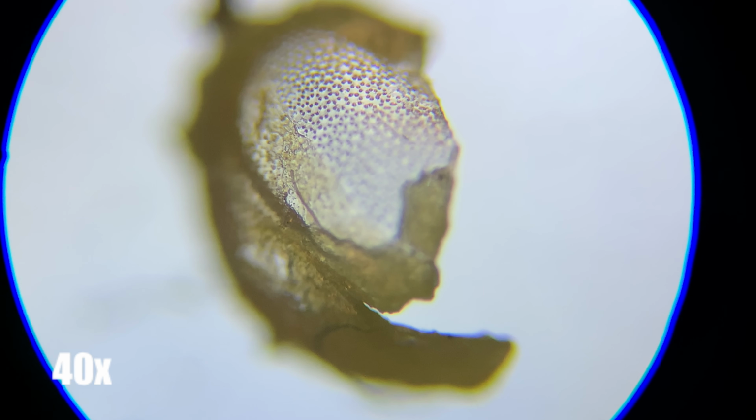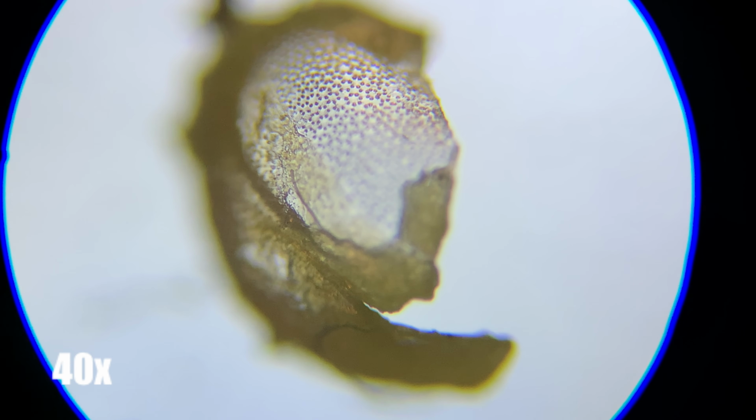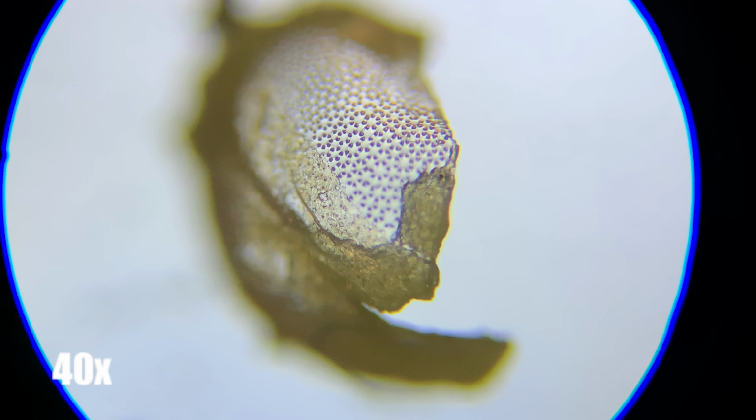Notice the structures on the inside of the egg. This was particularly interesting to me as these protein structures allow for the egg to supply oxygen to the cells inside. However, they create an eggshell that is so strong, it was actually difficult to open even while using a pair of pliers.